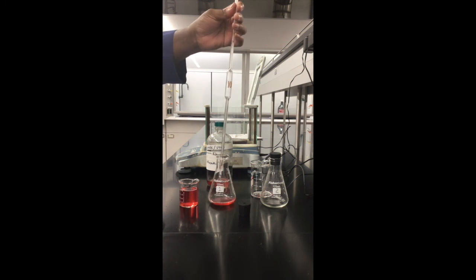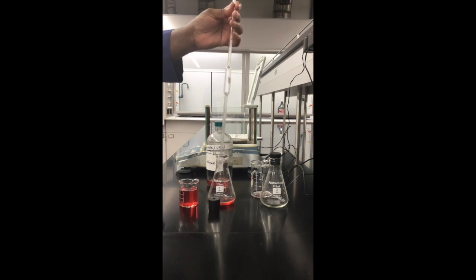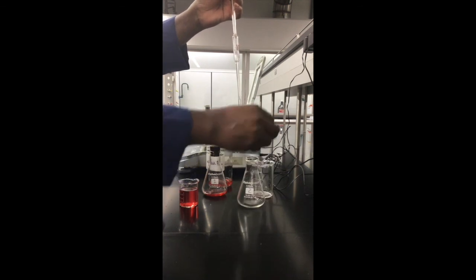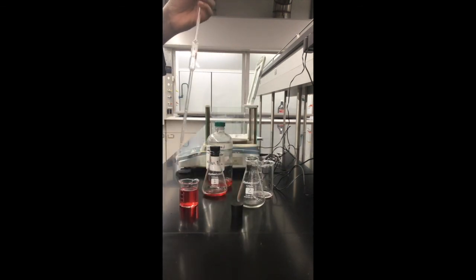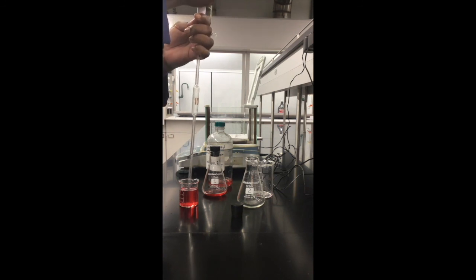I'll do the same thing for trial 2. Remember always not to mix up the stoppers, okay? So this is for trial 1. I'm just gonna keep that. We'll do the same thing for trial 2.